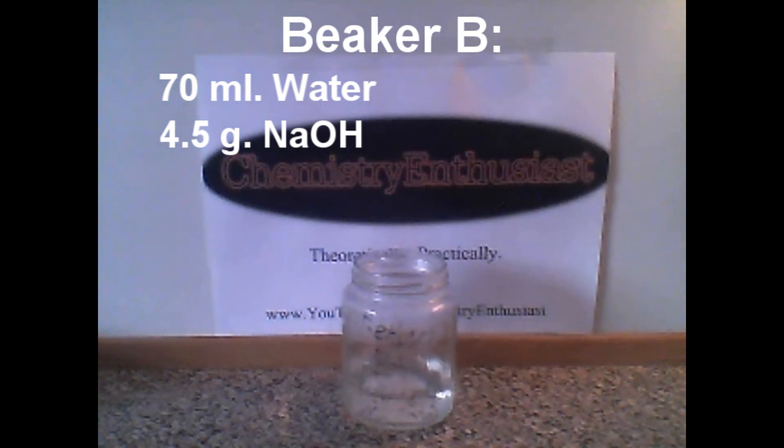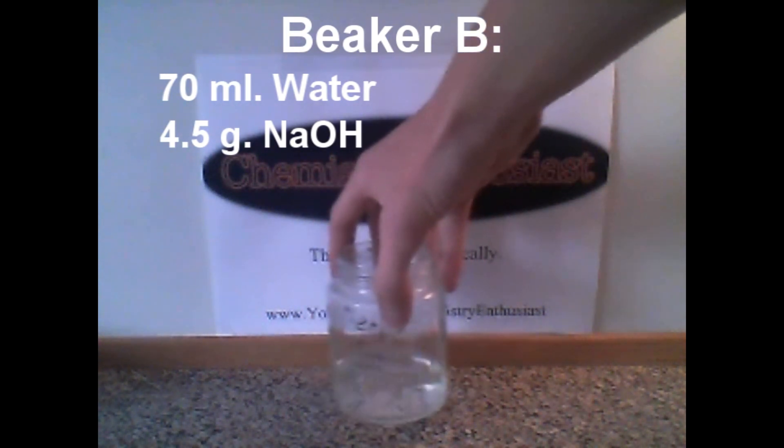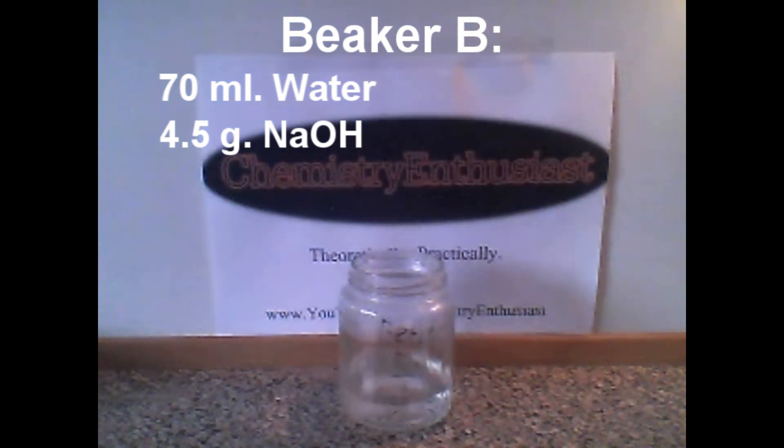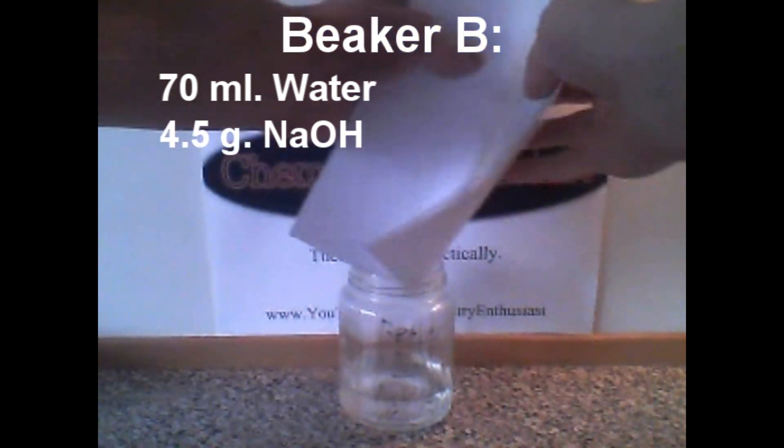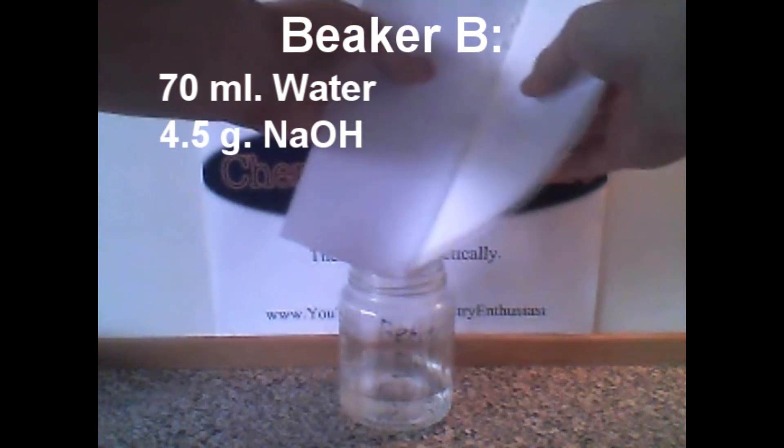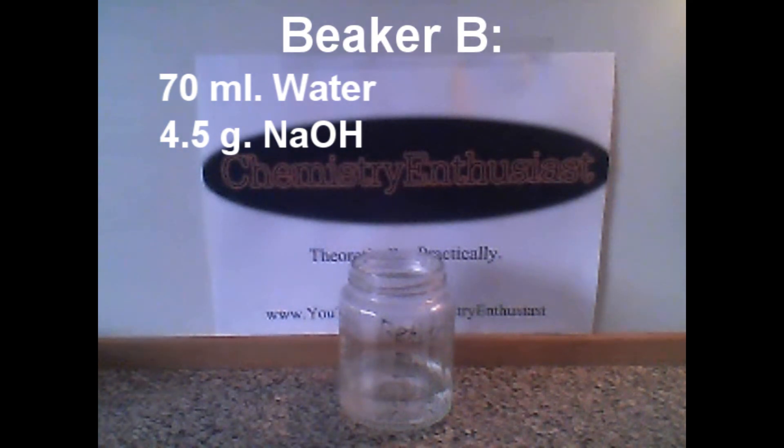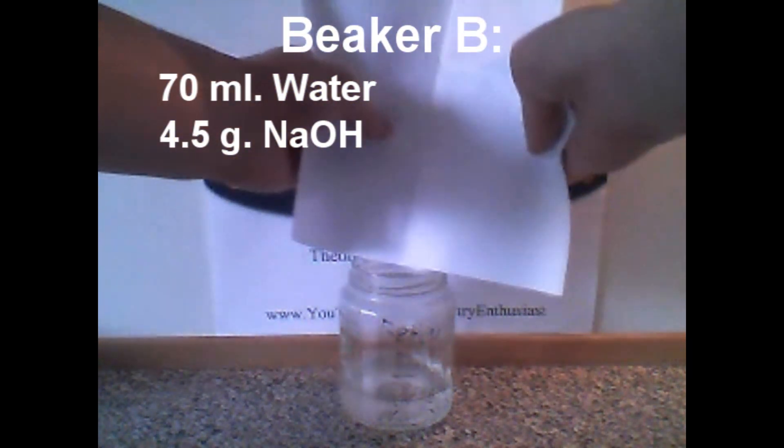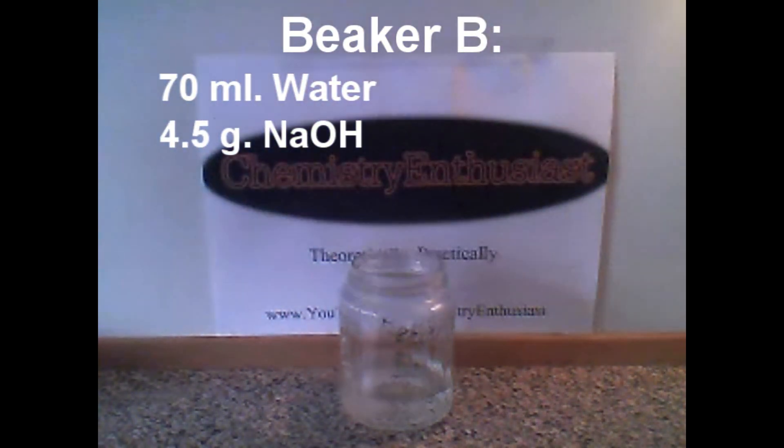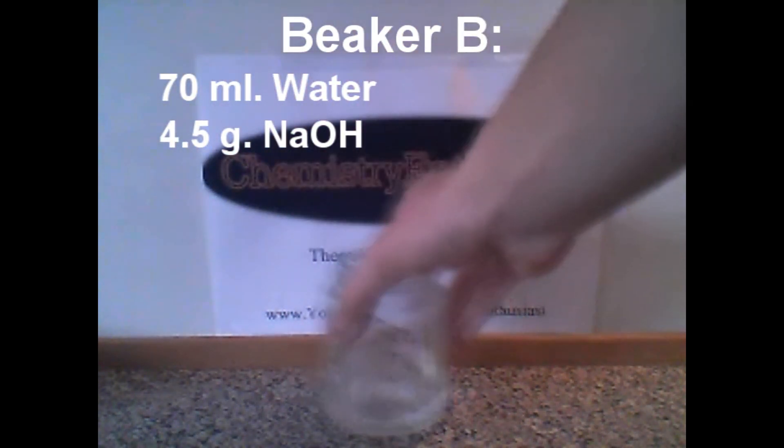This took some time. We are about there. And that's it. I gave up on getting the rest into the beaker.